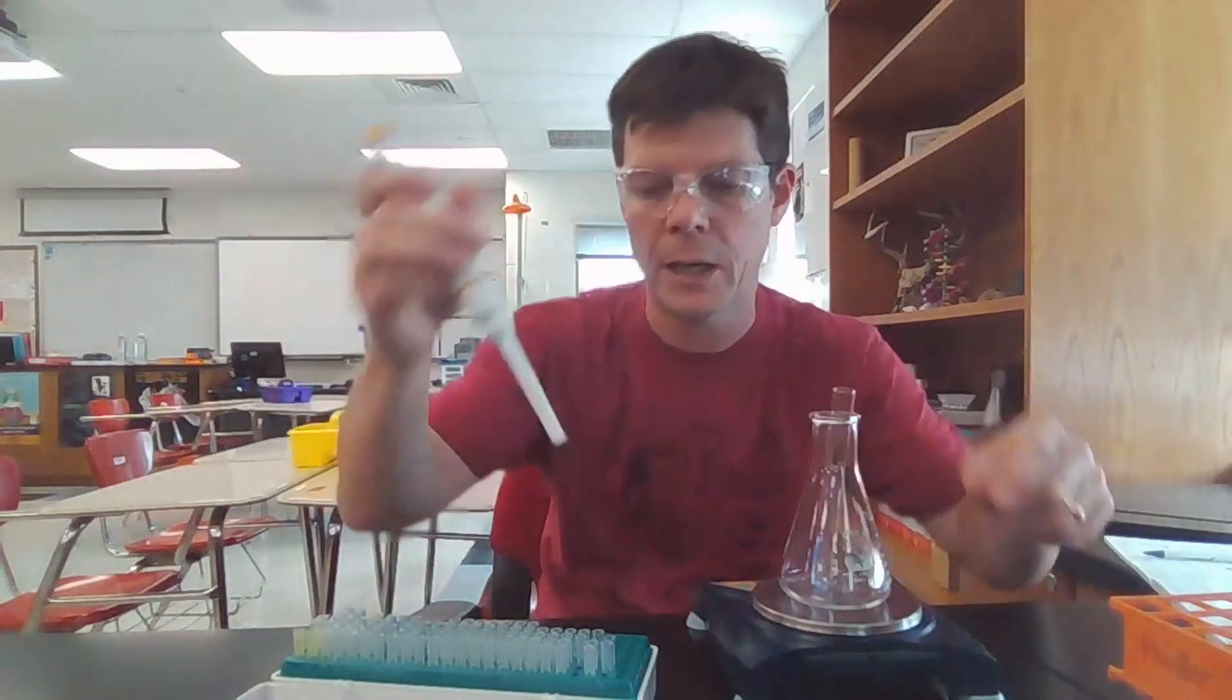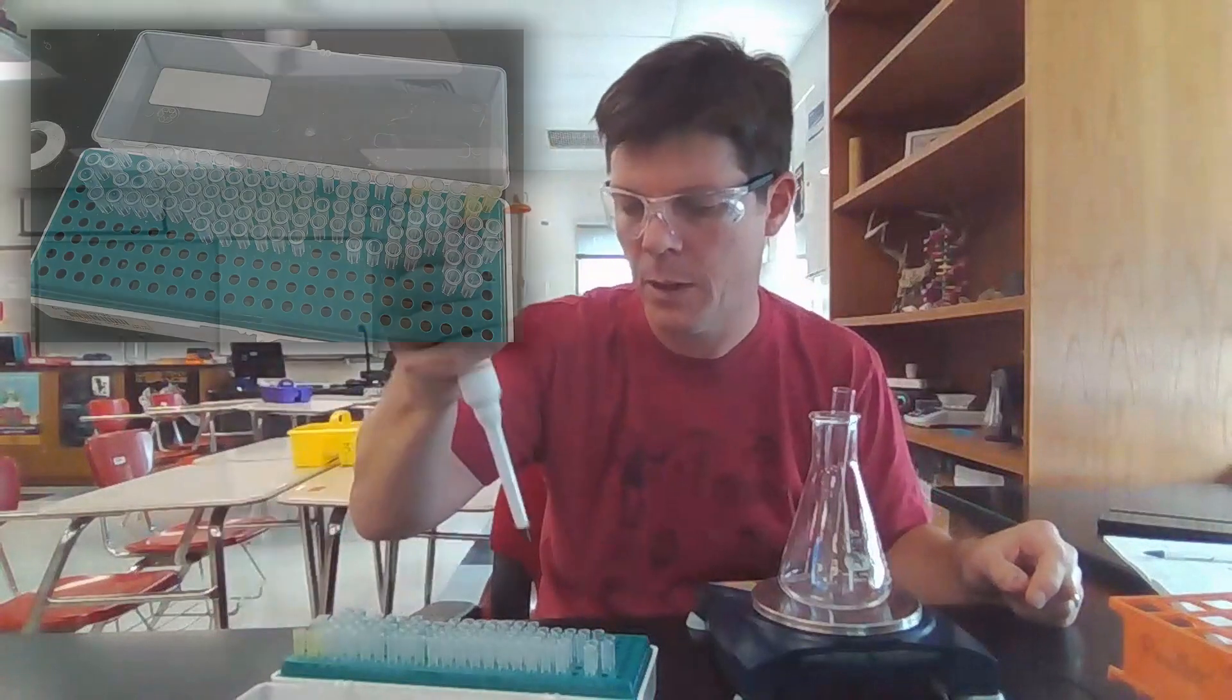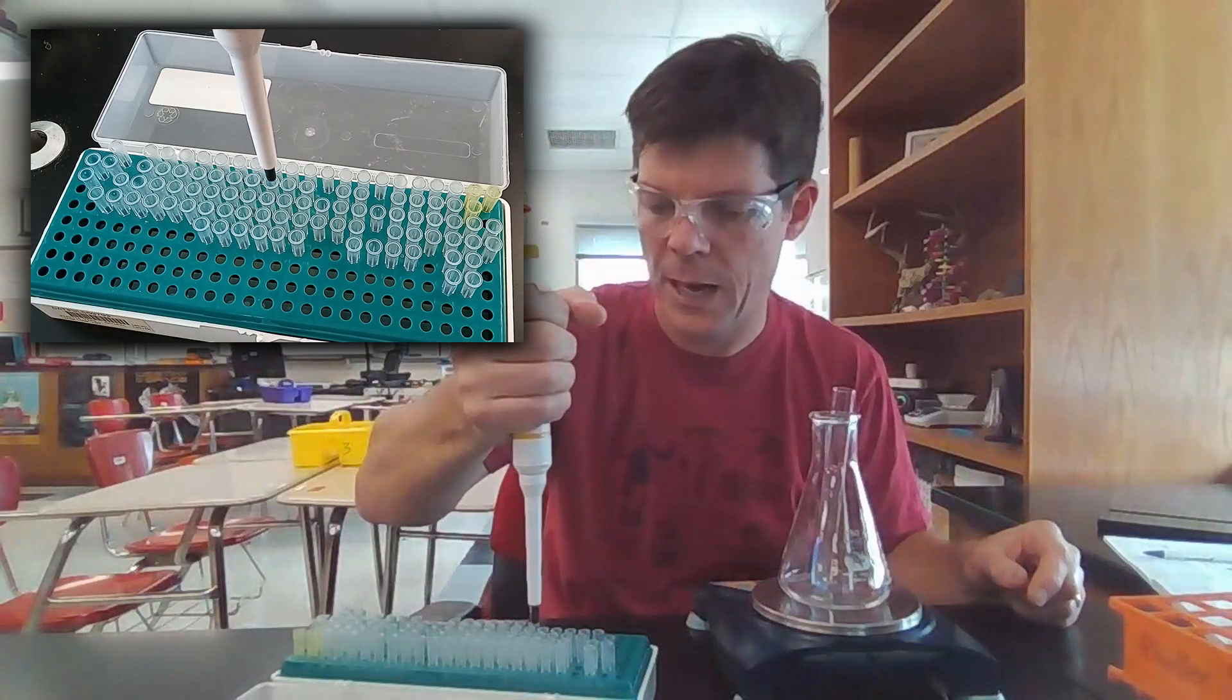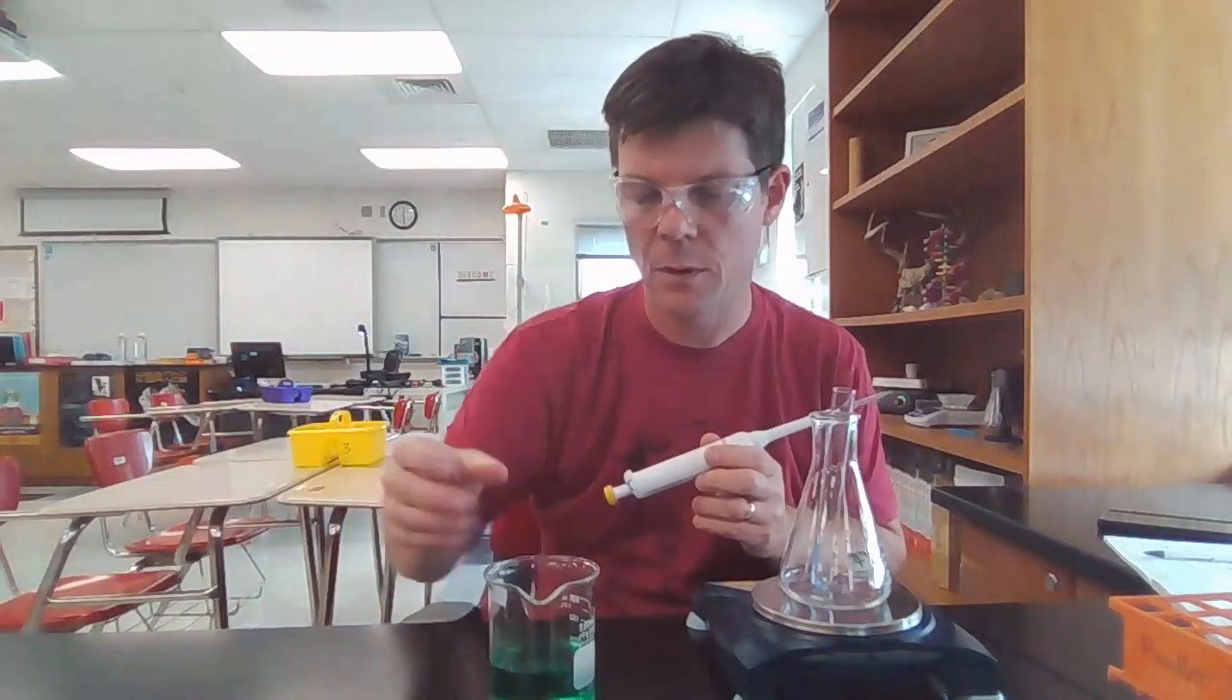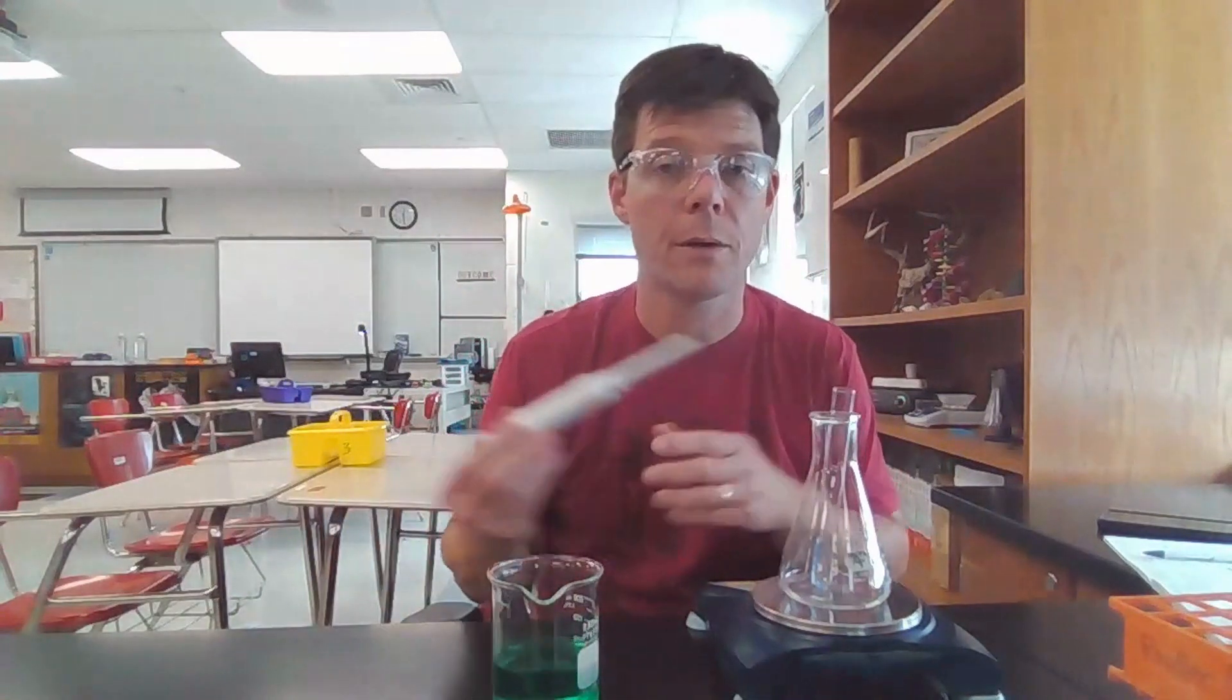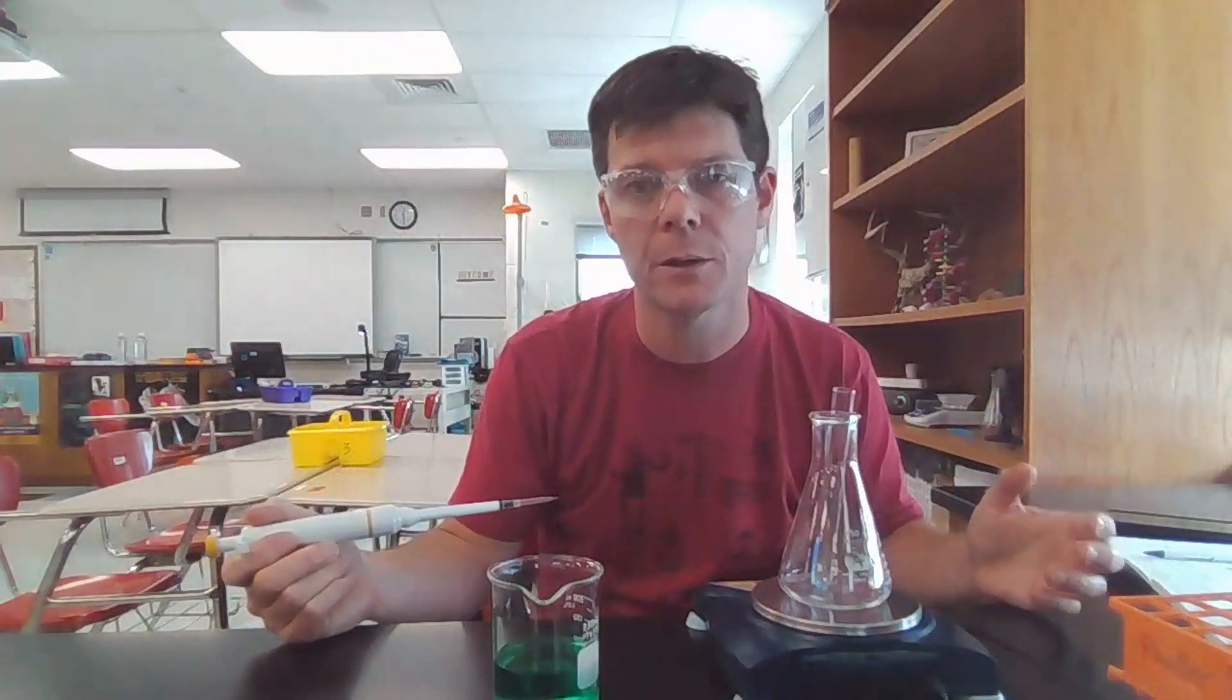And the end right here is going to go into a tip. I can just tap this down like that. I have it firmly in place, the tip. It's not going to fall out. And I have my beaker of water that I've added green food coloring to just to make things a bit easier to visualize.